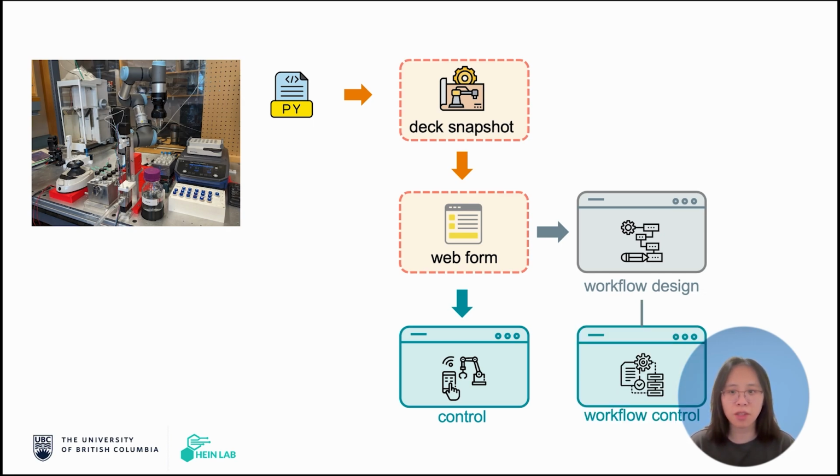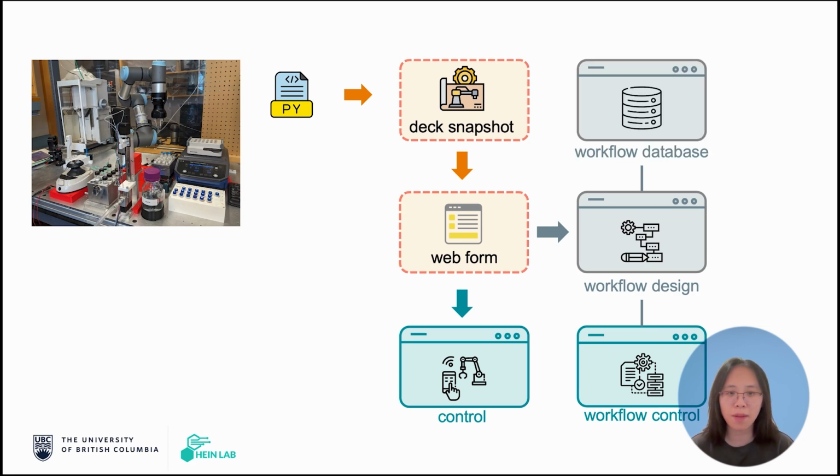In the execution interface, we have multiple options. For example, simply repeating the workflow a number of times, or more advanced adaptive experimentation if we have an output to optimize. On top of this, we also have a database interface where you can save and manage your workflows, probably from different platforms or from different authors. So again, we achieve this interoperability by dynamically inspecting the current SDL Python script before launching the web app. The web interface captures the current state of your robotic control script and makes it adaptable to any other platforms.